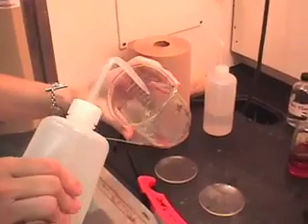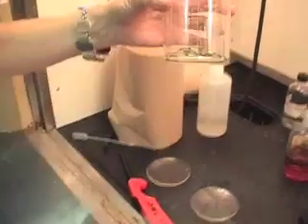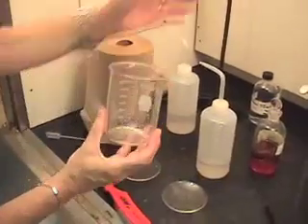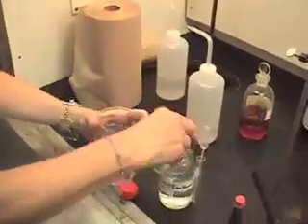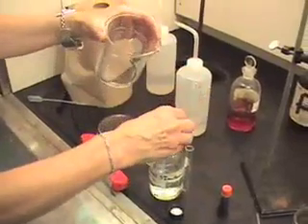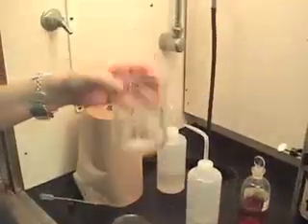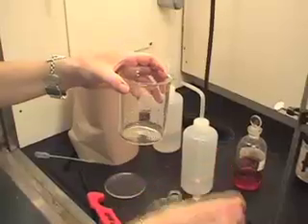I can tell it's a chemical property because heat is being given off. Now if I take this clear colorless liquid — water — we call that a compound because all it is is H₂O, so it's a pure substance. If I mix it with a little bit of ethanol, which is also clear and colorless, you'll see that the ethanol dissolves in the water — we say it is soluble. So that is still a homogeneous mixture called a solution.